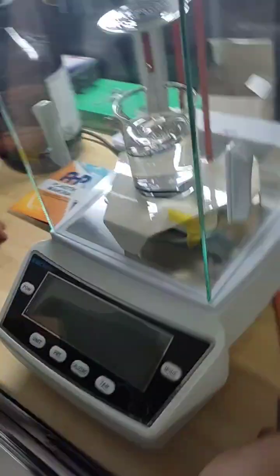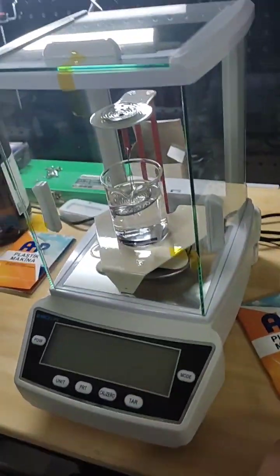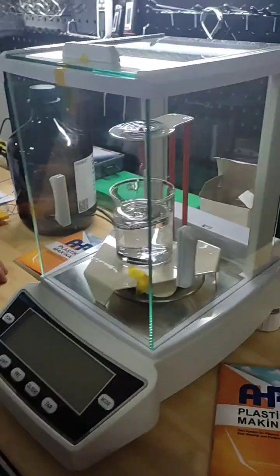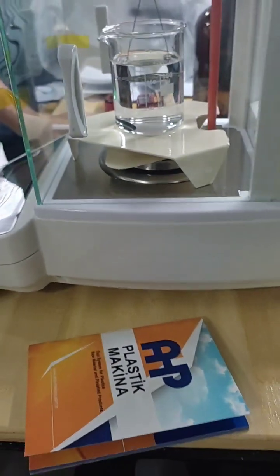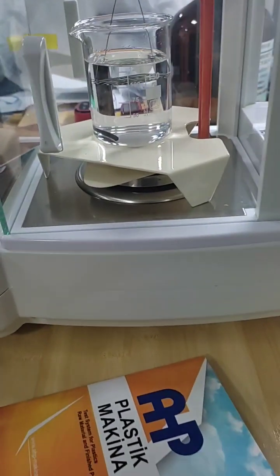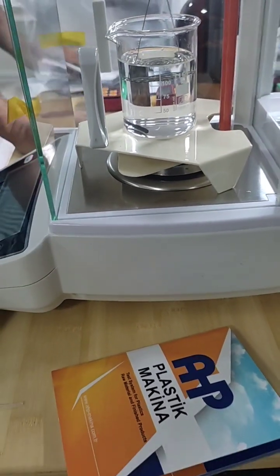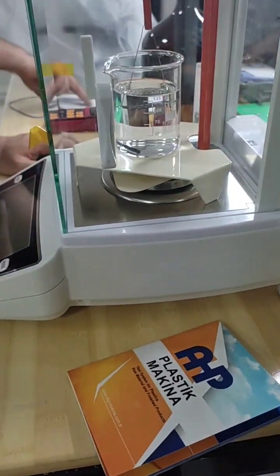Hey guys, this is AHP Plastic Makina Laboratory equipment for the plastic sector. In this short video I'm showing you how to set the precise balance to measure the density of plastics polymers using immersion method.